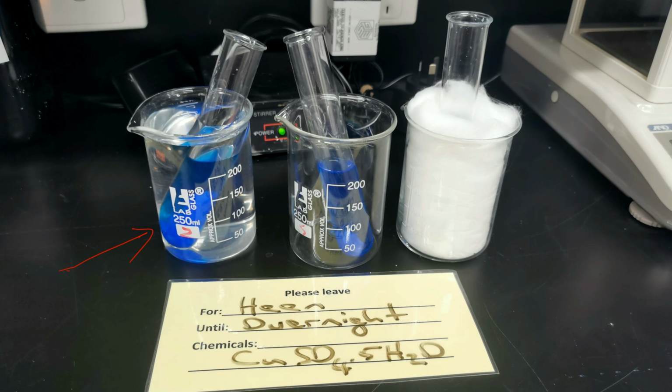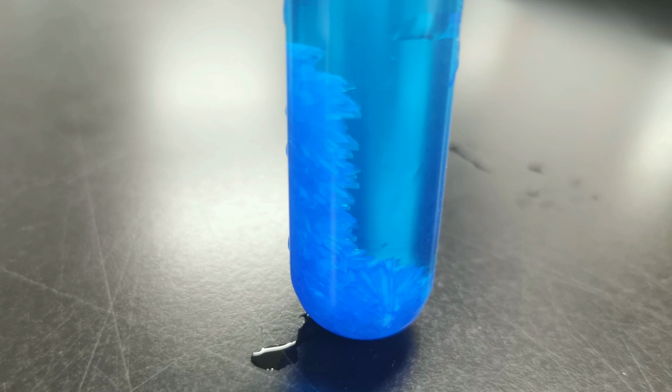But if you look carefully, you can see some crystals, ditto in the middle test tube there. We can see some crystals at the bottom. Can't quite see anything in the insulated test tube because we can't see through the cotton wool. But that's fine because we're going to pull out the test tubes and have a look at them. So let's start with the test tube from the ice bath. And voila, we have some crystals of copper 2 sulfate have formed.